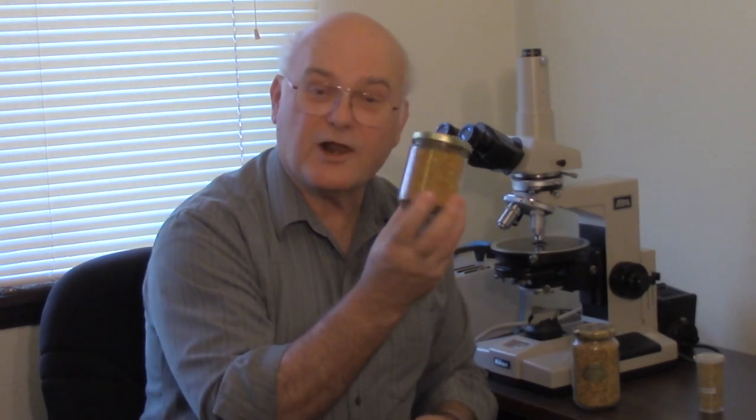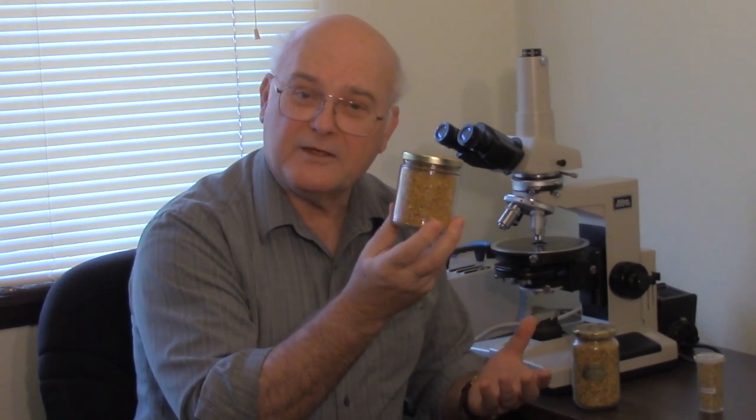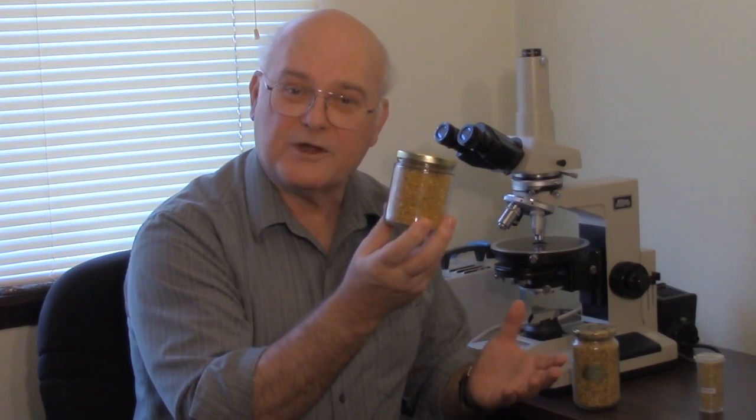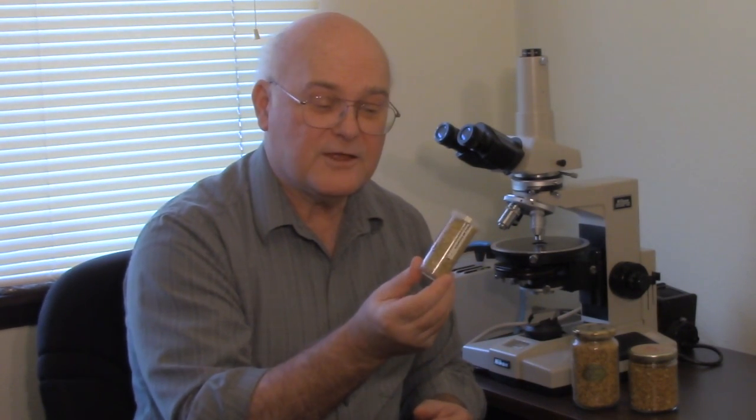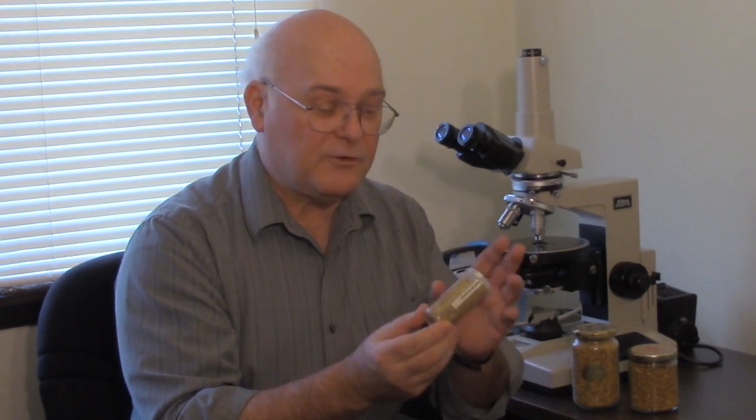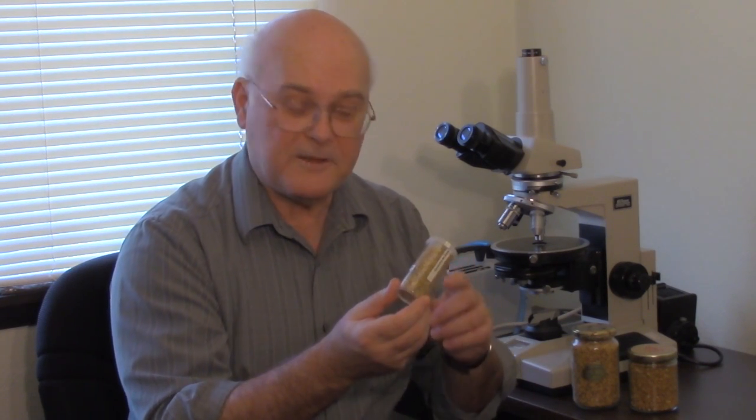This is another collection. This is from just outside of Florence, Oregon. This is another collection — this one is out of South America, Paraguay.